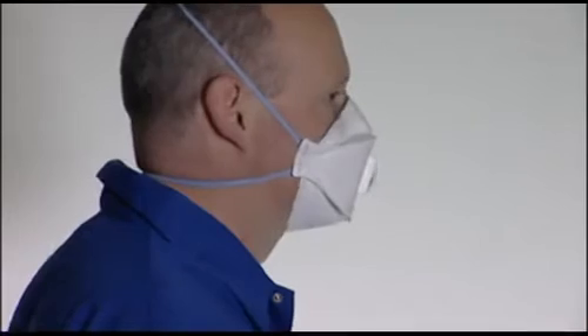This video will demonstrate how to fit the 3M Aura 9300 Plus series foldable respirators. Before fitting your respirator, make sure that your face is clean-shaven. Respirators should not be worn with stubble, beards, or other facial hair under the area of the face seal, as these can prevent a good seal to the face. Make sure that long hair is tied back and jewellery is removed so that it does not interfere with the seal to the face.